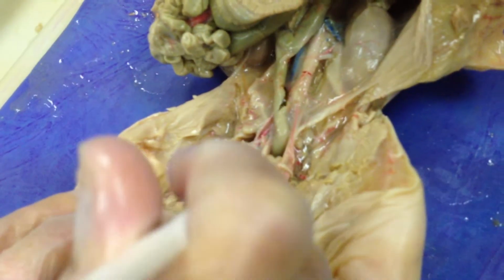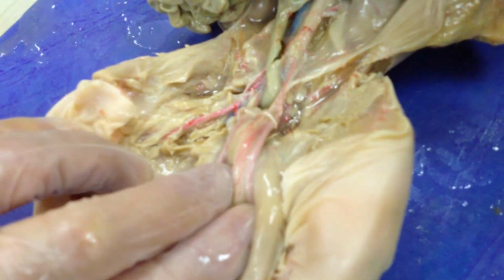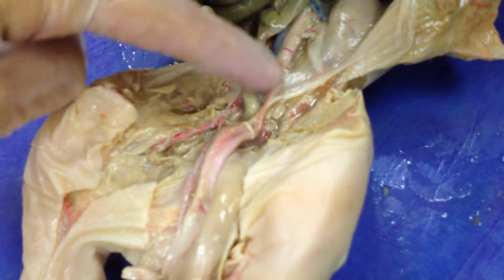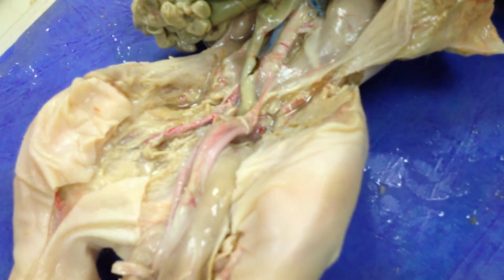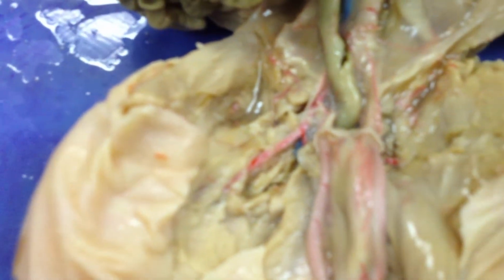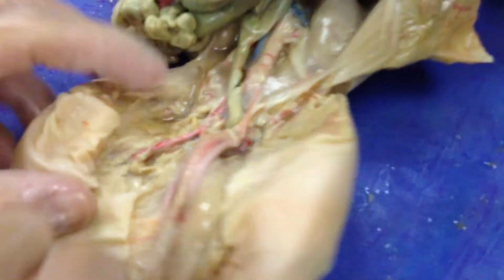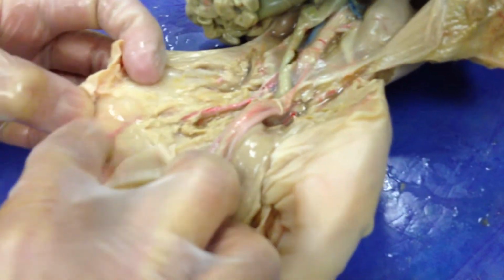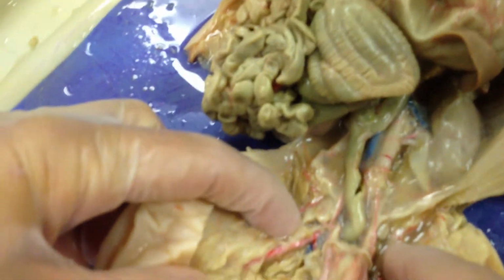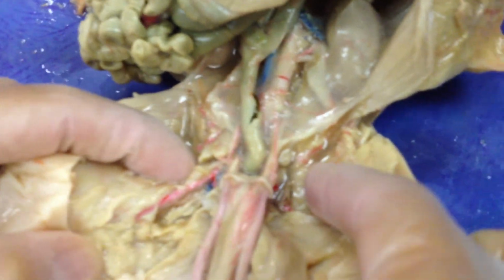Yep. There we go. So this is, we are not going to worry about internal versus external on the pigs. If it's tagged down here after the aorta splits, call it the iliac and leave it alone. Okay? So you can go back to your thing and mark off internal and external everywhere you see it. I just want to know iliac. And then when you come down here, then it becomes femoral. But up right in here, a very short iliac. I'm not going to try to differentiate between internal, external, and common. Okay?